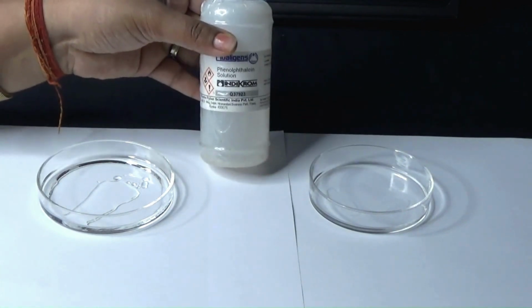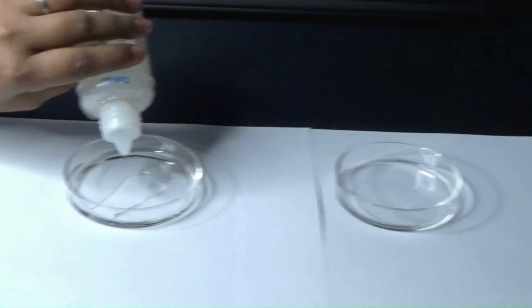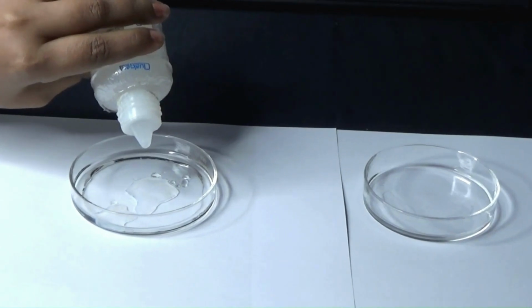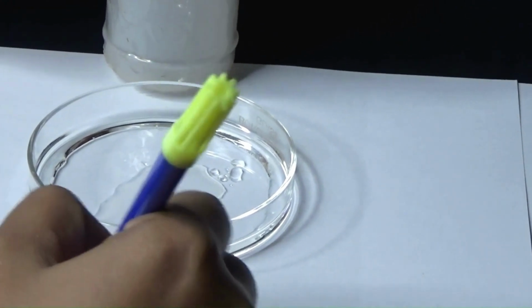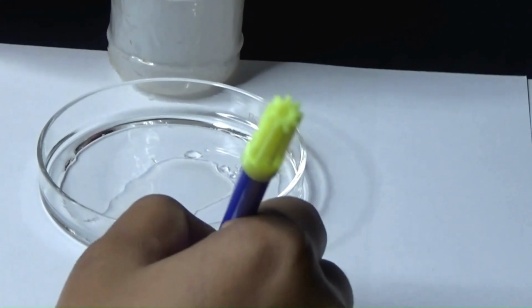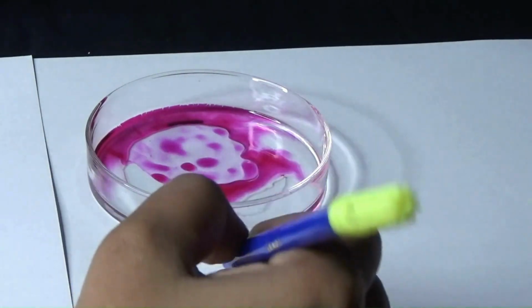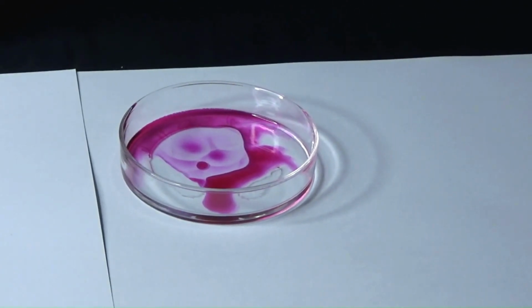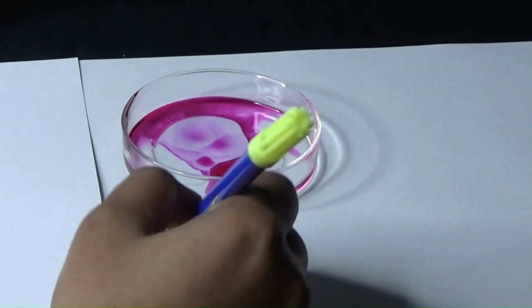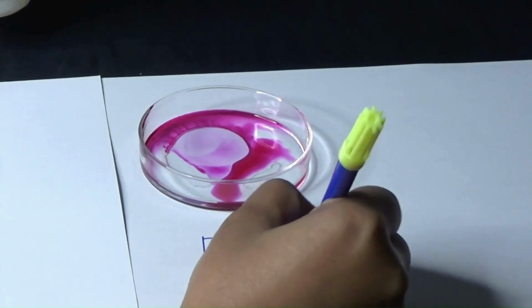We have another one here, phenolphthalein, which is itself colorless. So let's put a drop of phenolphthalein in these two bowls. One drop here and nothing happens. So we can decide that this must be acid because phenolphthalein does not change color with acid. No color change, we have an acid. But now let's put it inside an alkali. Wow, what a bright pink color, magenta. And therefore we can call it a base or an alkali. So let's write base here because phenolphthalein has changed its color.